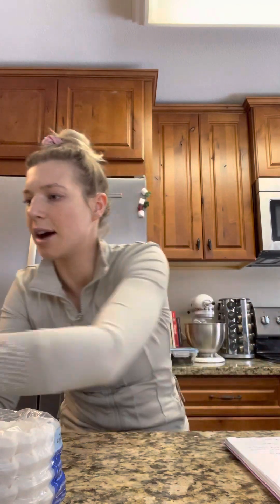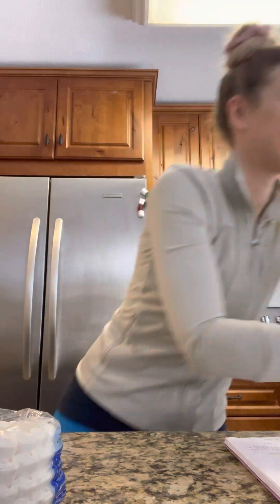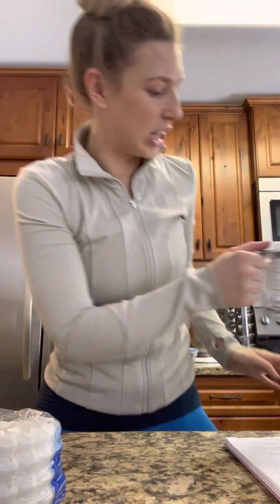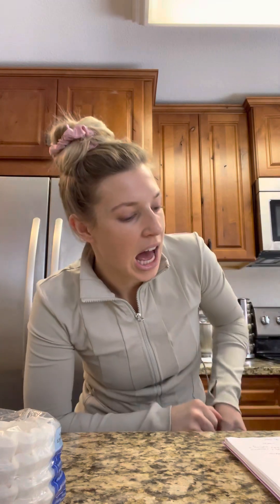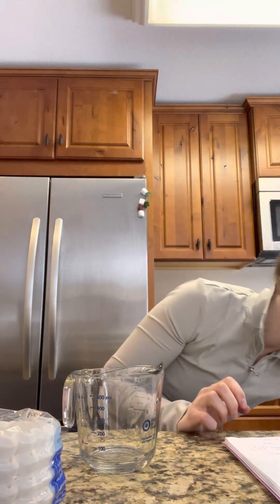Because I spilled some out I may have less for this next solution. First, Solution A — we're going to pour into here, and I'm going to set this off to the left of my screen. Solution B is going to be about 0.4 grams of cornstarch mixed with about 150 milliliters of hydrogen peroxide, and then we're going to add water.